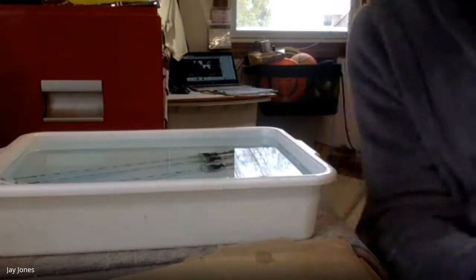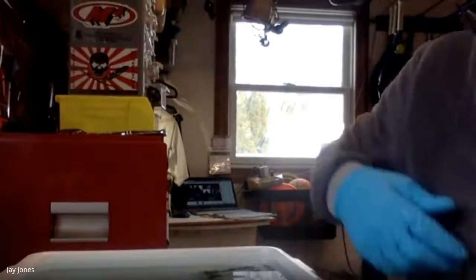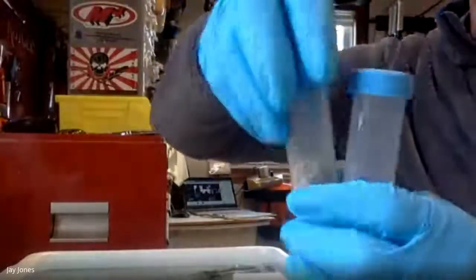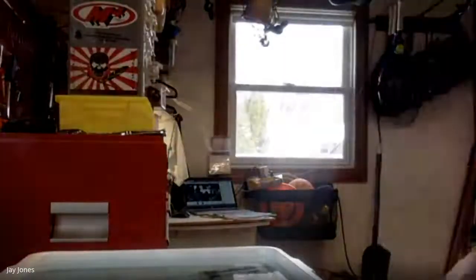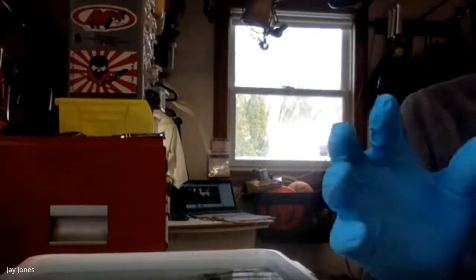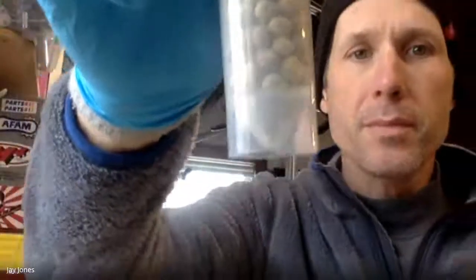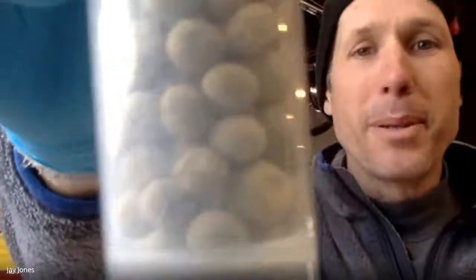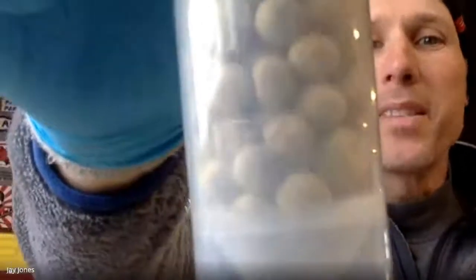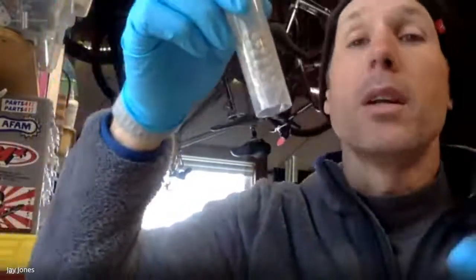So while this is going on for the first time, let's briefly talk about what's going on here. The germinating peas, we got 2 minutes. The germinating peas are plump. They're plump, and they're doing really well. The dry peas, they're not plump. They're dry. They're dormant. But are these dry ones cell respiring, right? Are they respiring? I don't know. Maybe they are, maybe they're not. I don't know. That's the whole point of this lab.